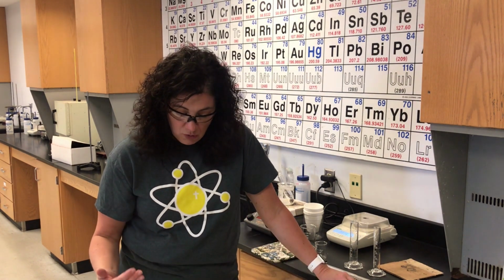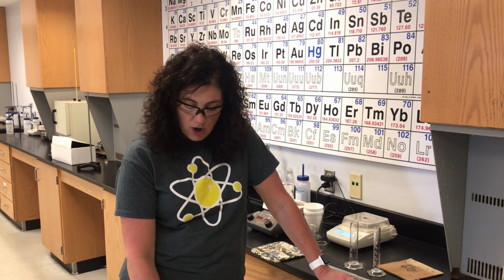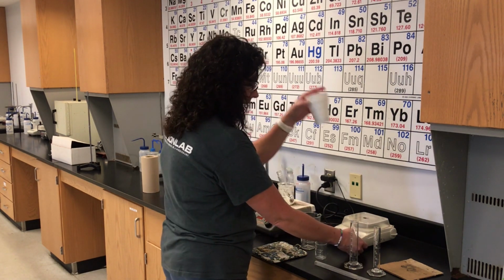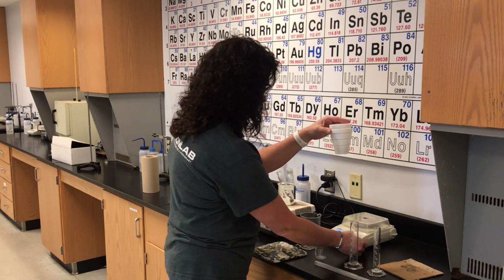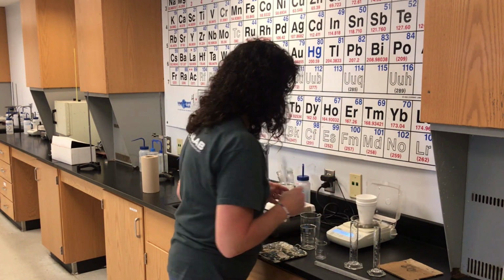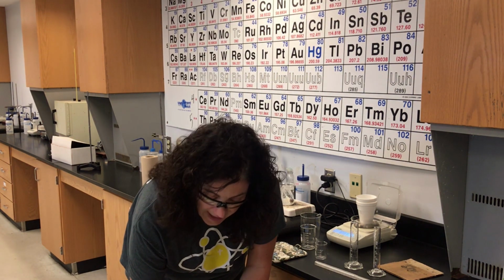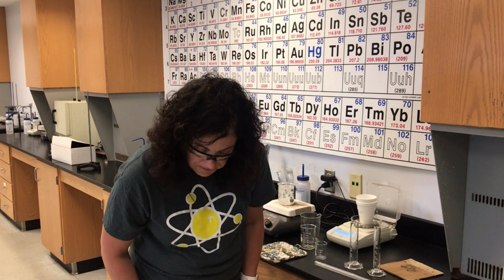Meanwhile, following along with the procedure, the 4th paragraph says that while the water is boiling, weigh the calorimeter. I'm not going to weigh it in the beaker, I'm just going to weigh the styrofoam cups. So I'm going to zero out my balance and weigh my calorimeter. The mass of the calorimeter is 4.210 grams.